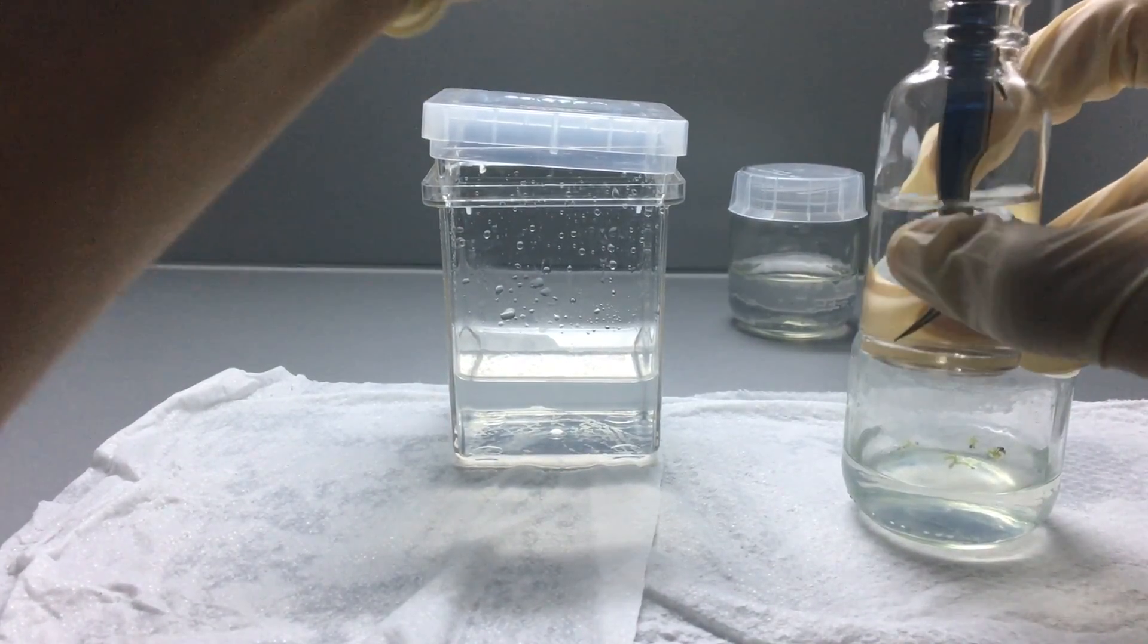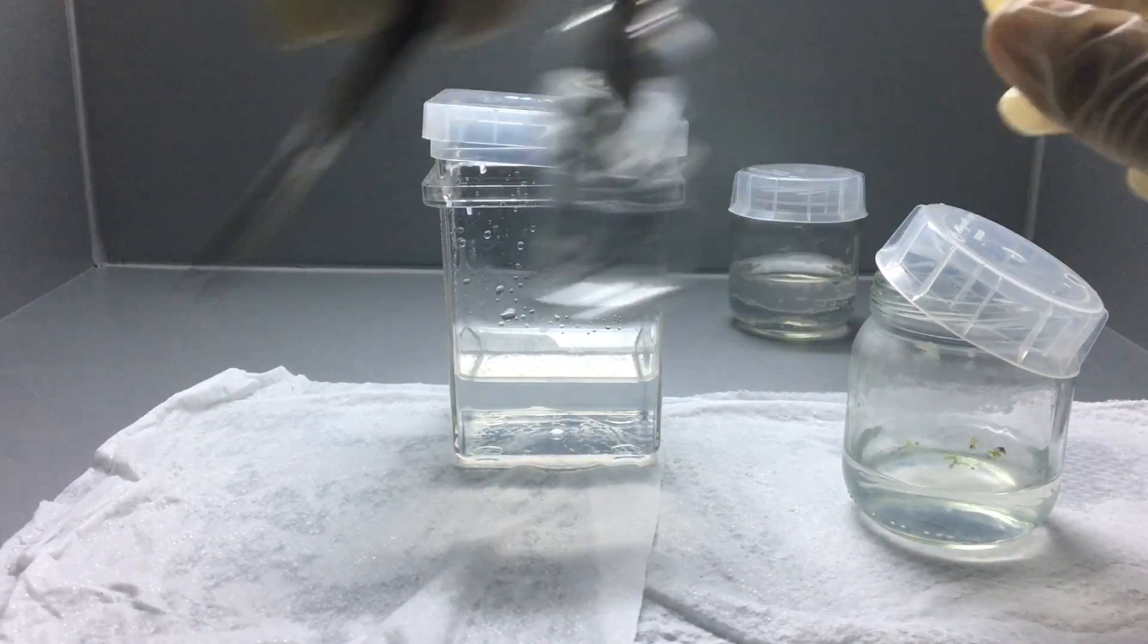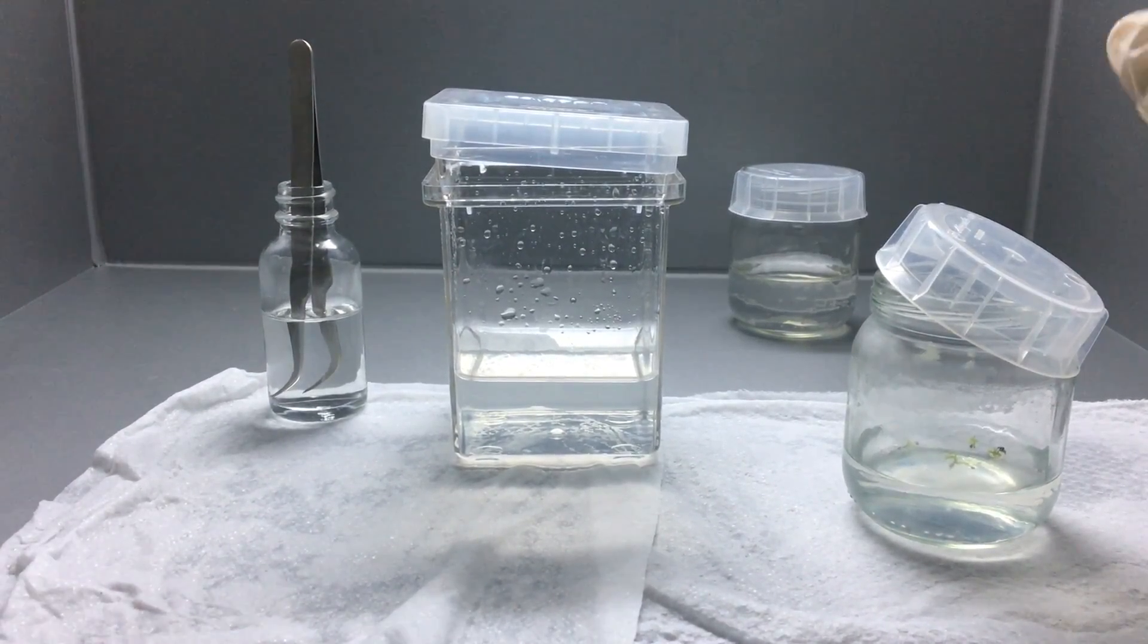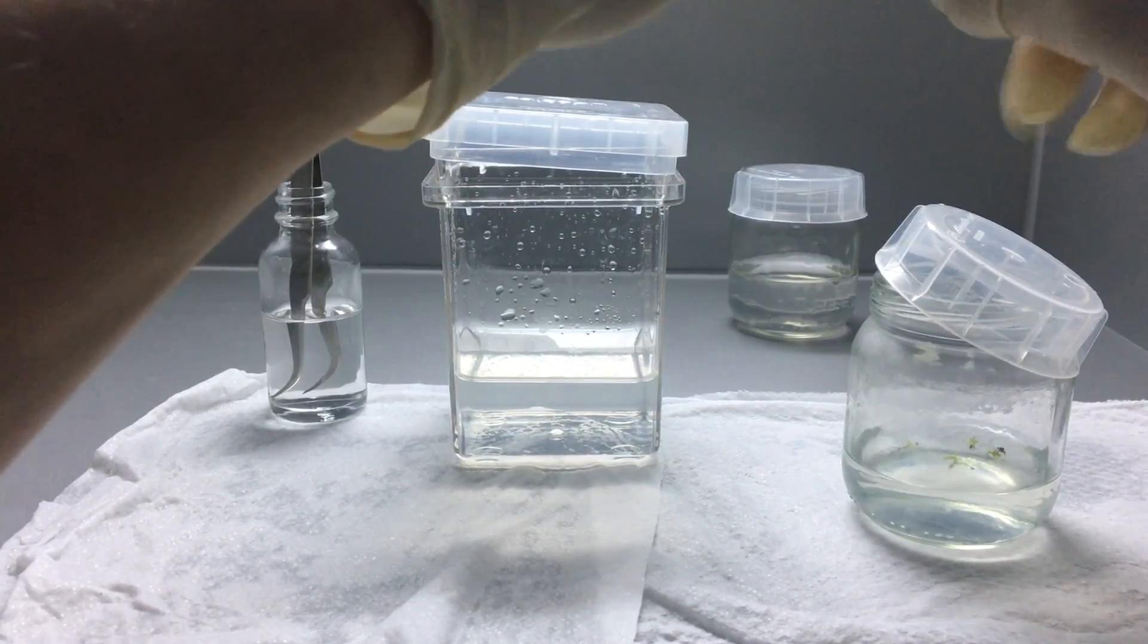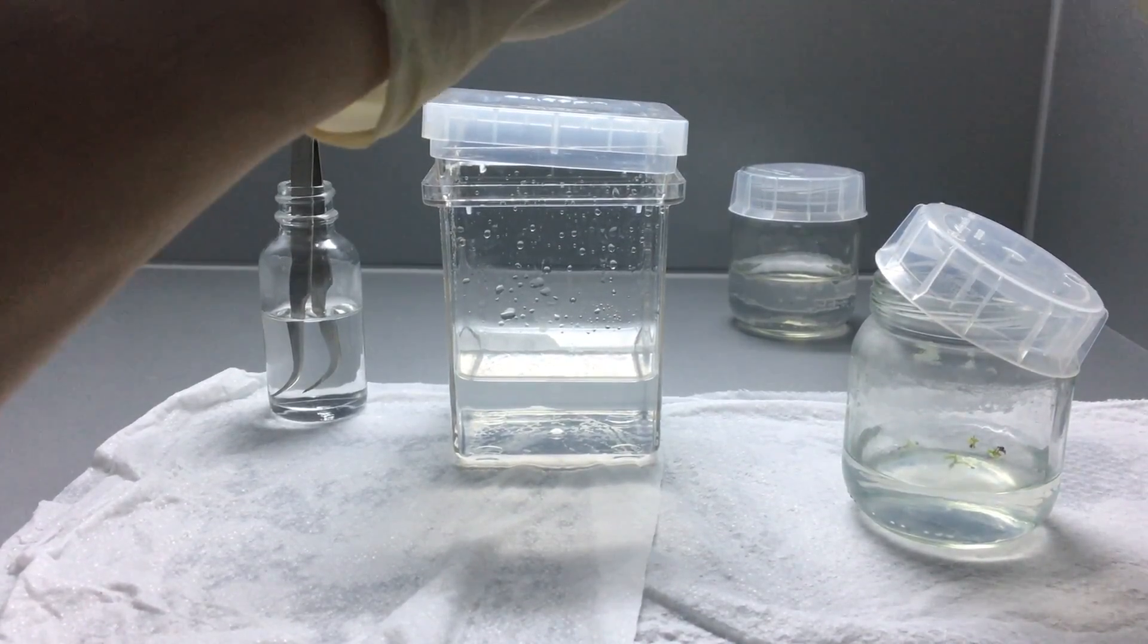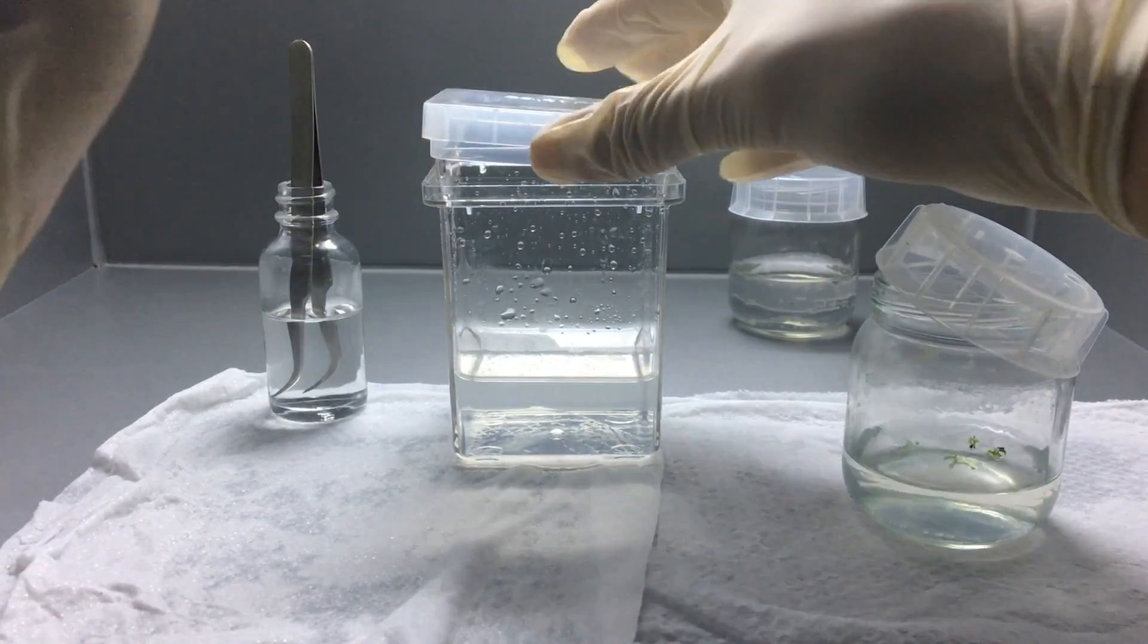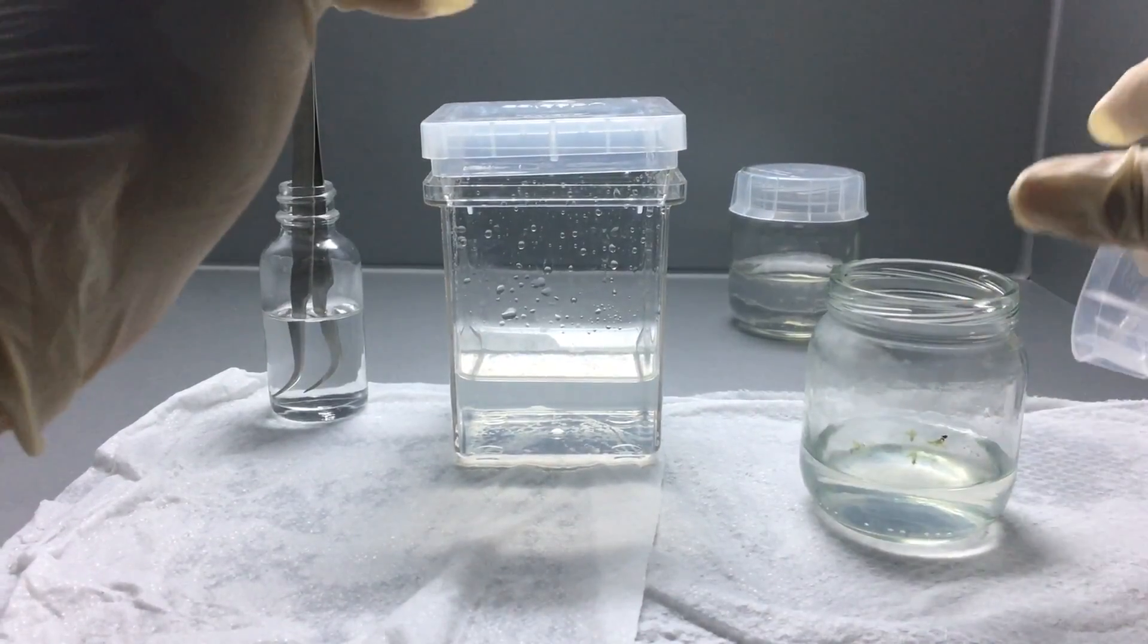Here I'm using some stainless steel tweezers that I flamed before putting them into the hood. So what I did was I washed them with soap and water, flamed them with alcohol, and then sprayed them again with alcohol after being flamed, and then put them into the hood and have them soaking in more 91% isopropyl alcohol all the way until they get used for the cultures.